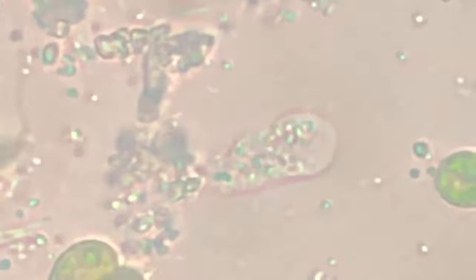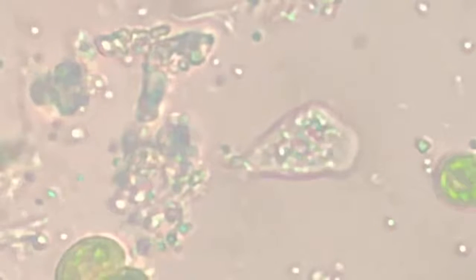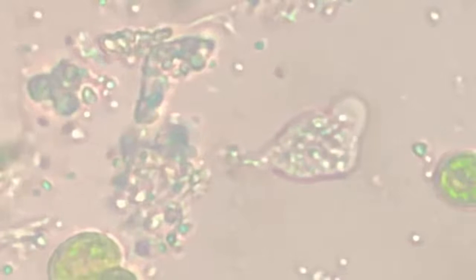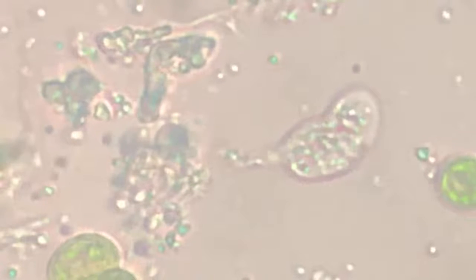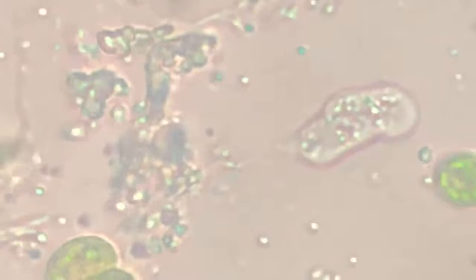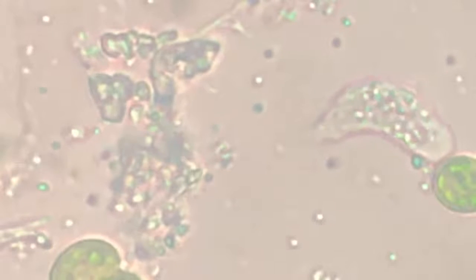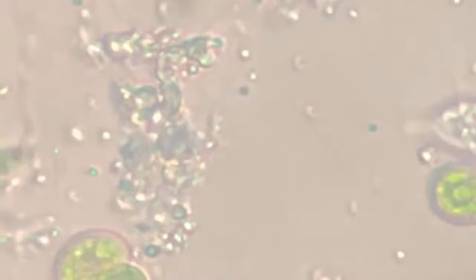The genus is, of course, Amoeba, but what I was trying to say was Amoeba proteus. The name itself comes from a Greek god, Proteus. Proteus was the god who could change shapes, and it was for him that the properties of this animal were matched and it got the name. There was another Greek god by the name Ra, R-A, Ra. Ra was another god who had the capability of changing shapes, and the story of Ra is a very fascinating one in Greek mythology. Let me bring him back in focus.